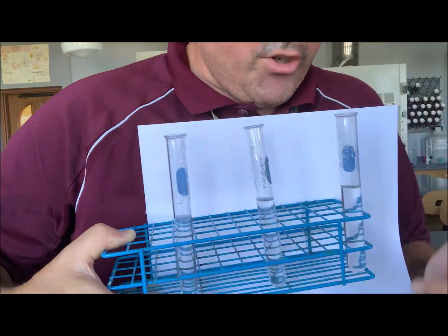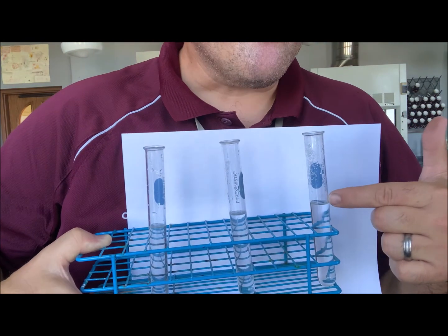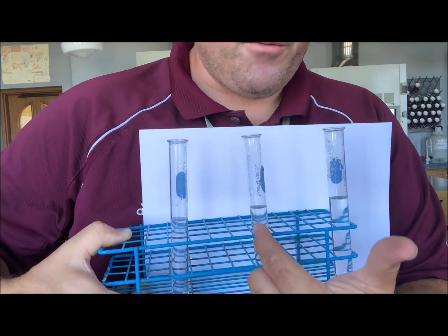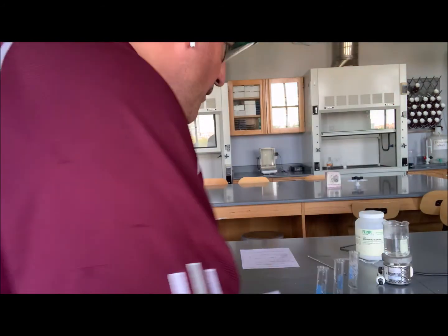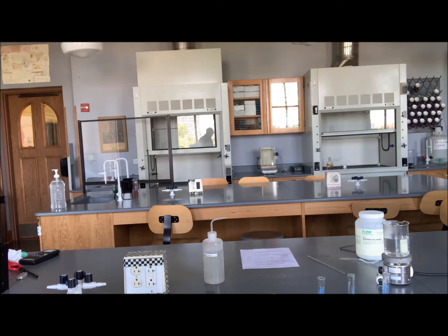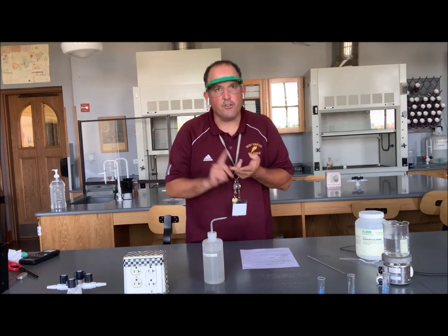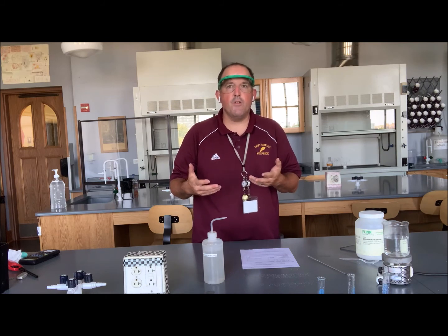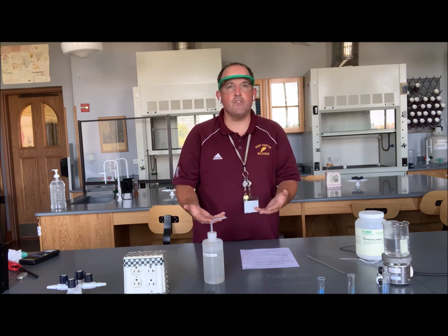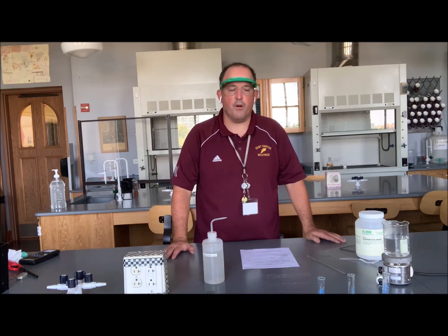So if you were judging which one dissolves best, I'd say boiling water for sure is the fastest dissolver, followed by half hot, half room, followed by all room temperature. And again, what does that tell us? Can we draw a connection? If you think back to part 1 of the lab, we had concluded that swirling helps and crushing helps get substances dissolved. The reason for that is it's constantly exposing new particles to each other, solvent particles coming into contact with new solute particles.